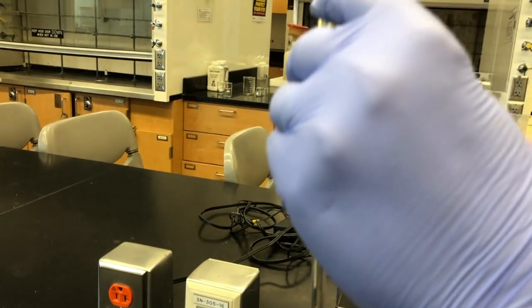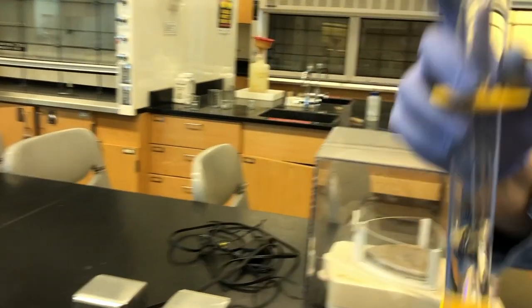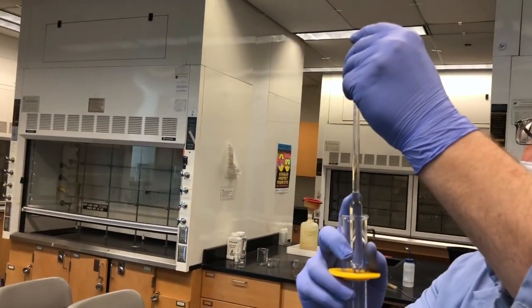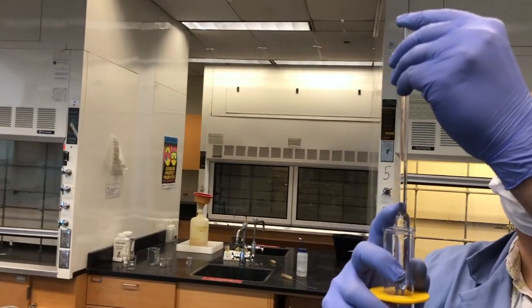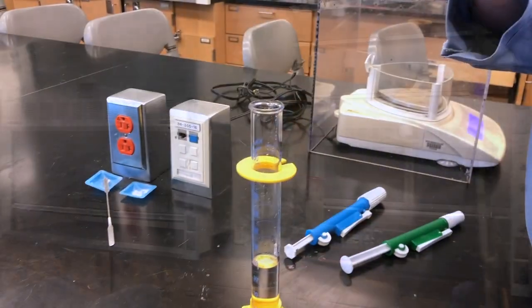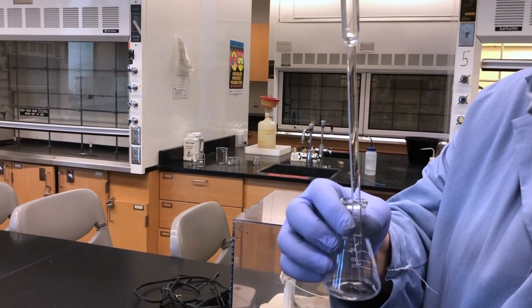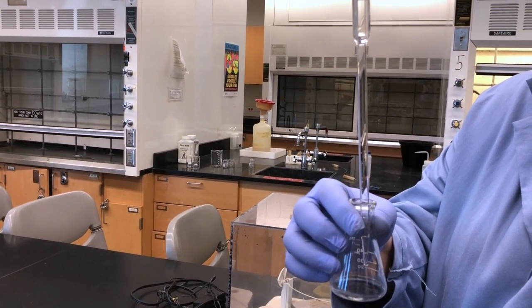We can then re-weigh the 10 mLs and from that, get the density of this mixture.